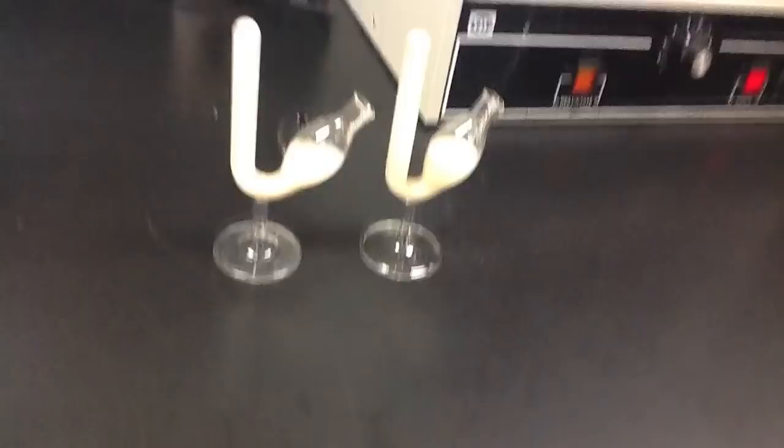Further examination at the end of the experiment does reveal that one of the two tubes was able to perform a great deal of fermentation, while the other one was not able to perform much fermentation at all. This, of course, is due to the amount of sugar available to the yeast in each of these tubes.